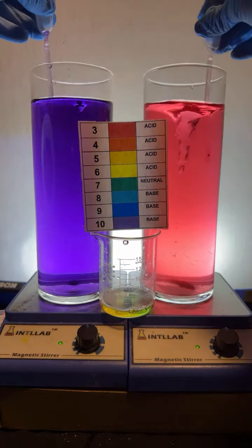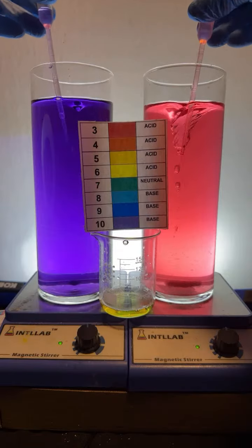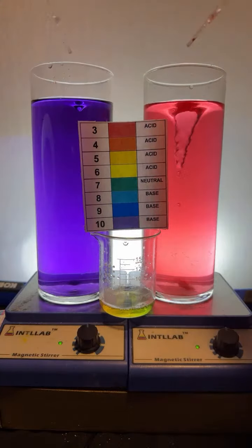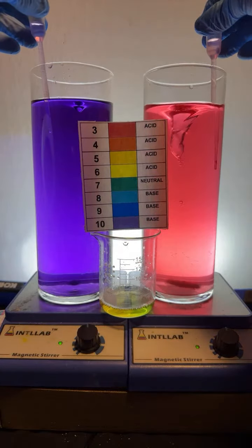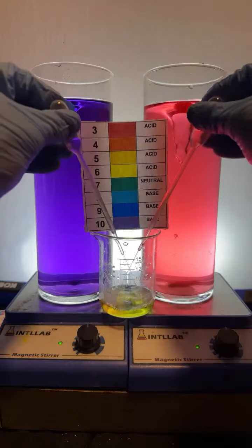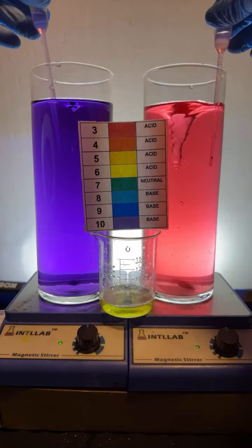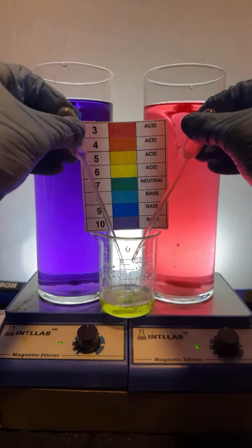Were you right at what color you thought you'd see? Fighter09 says green. Fighter09's been paying attention. That'd be my guess too. But it might be the case that the acid and base aren't the same concentration, in which case we might see something that's a little different than green, okay?